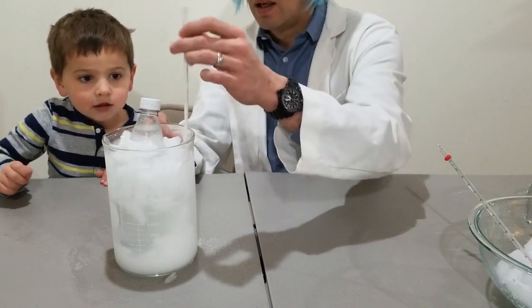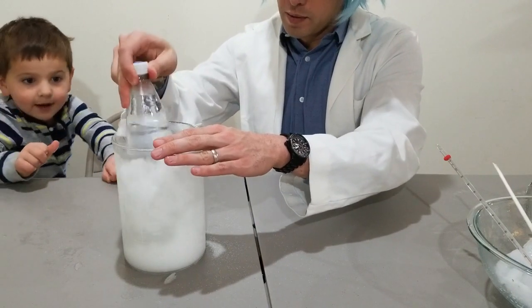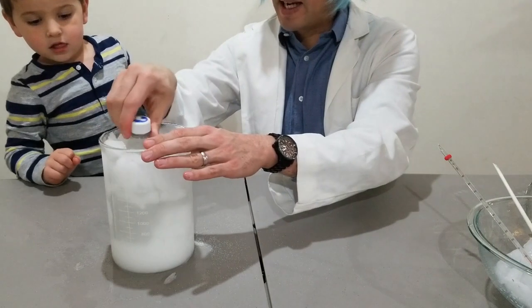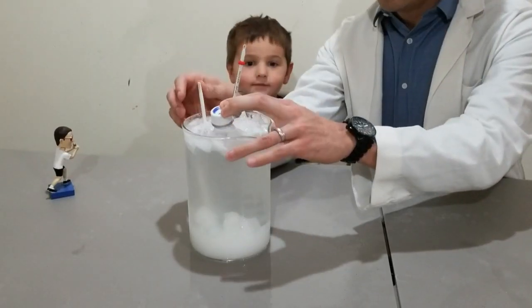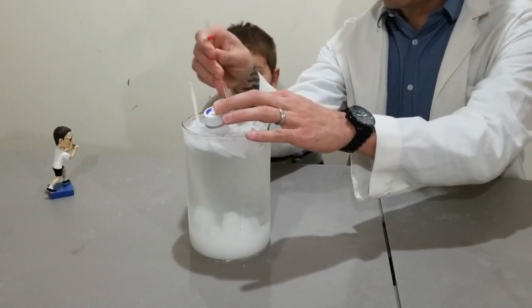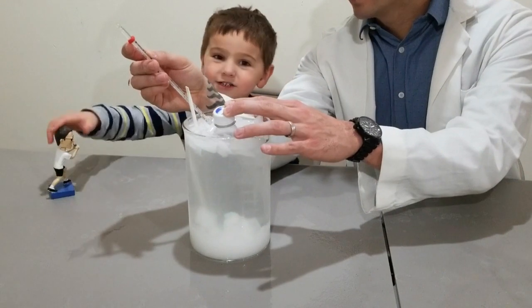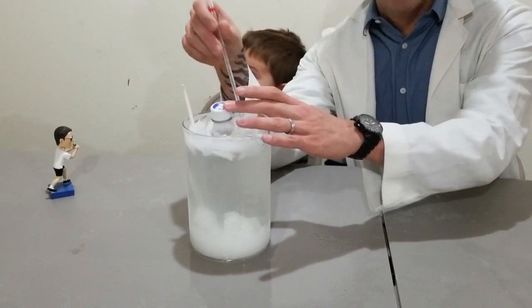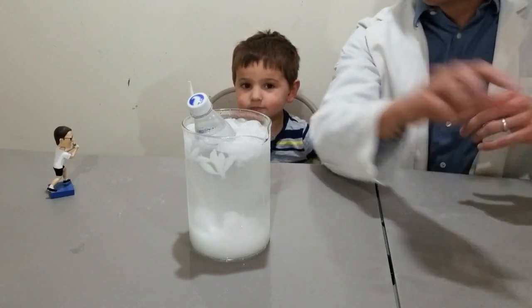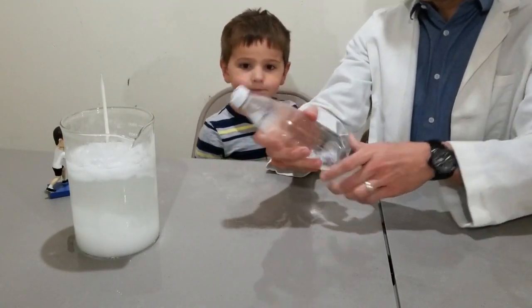There's something in the seltzer that's also making it not freeze. The seltzer has been sitting in the salt water for about 10 minutes. The salt water is between negative five and negative seven degrees Celsius — definitely below the freezing point of water — so we have to assume the seltzer is also at that temperature, but it is still liquid.